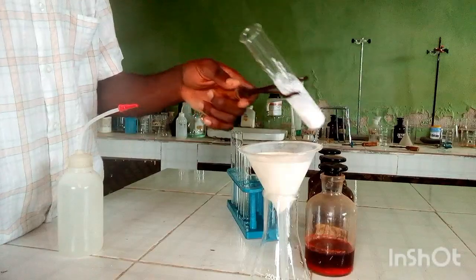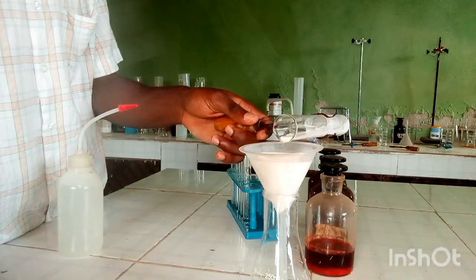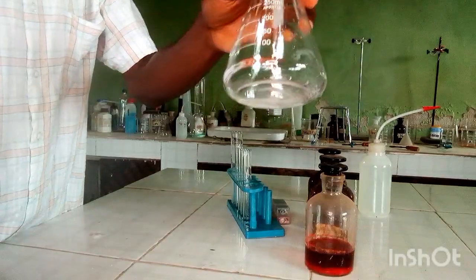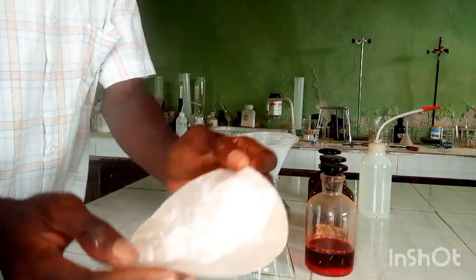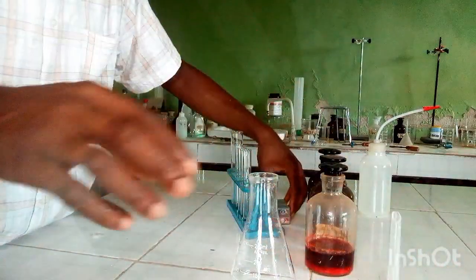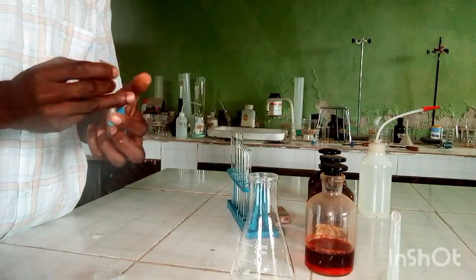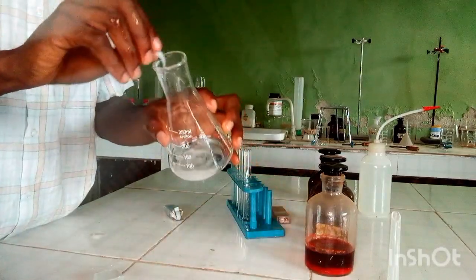The inference is that C is a partially soluble salt and contains both soluble and insoluble components. I'm now filtering the mixture. This is the filtrate and this is the residue here on the filter paper. Keep the residue to one side and perform the test on the filtrate. We're going to test the filtrate with litmus paper — I'll test with blue litmus first and then with red, testing both to be sure.